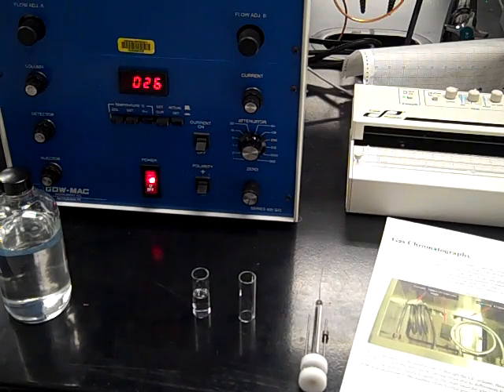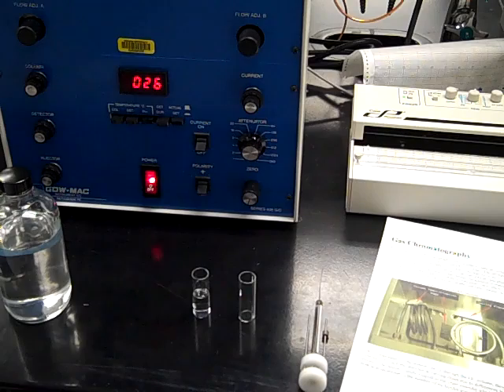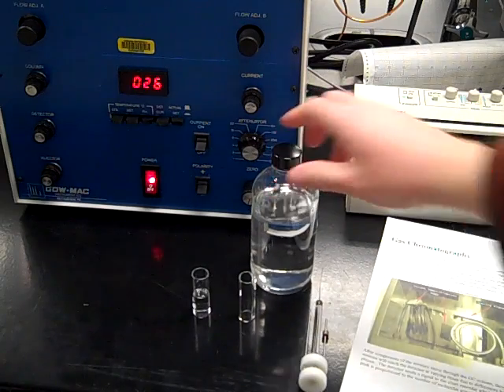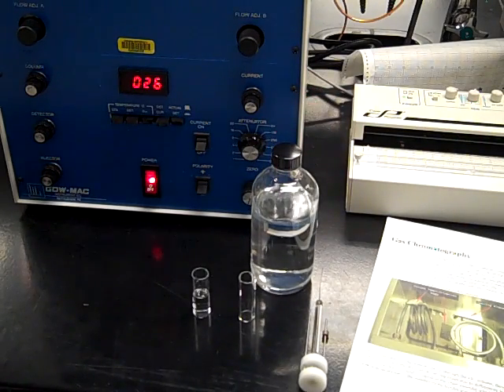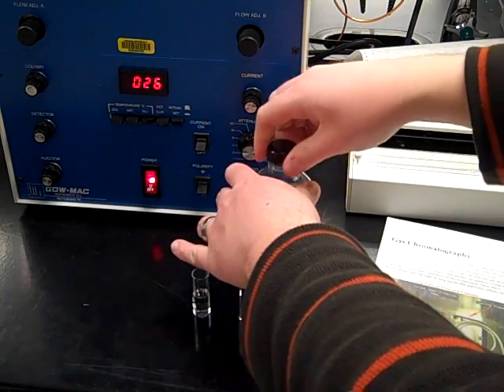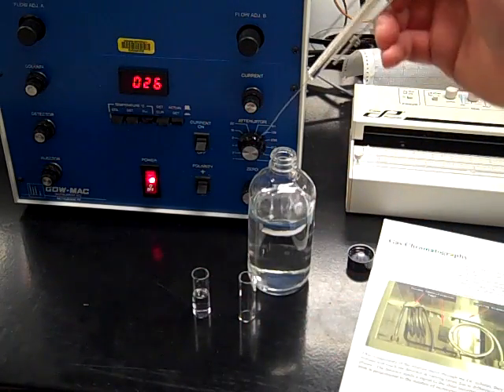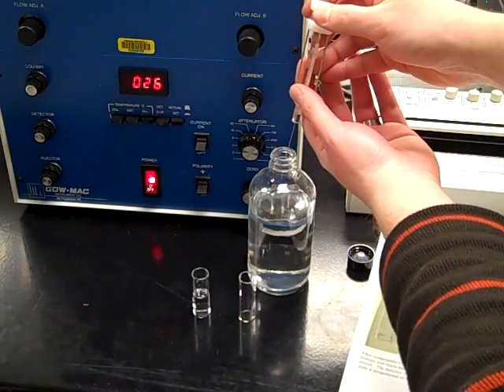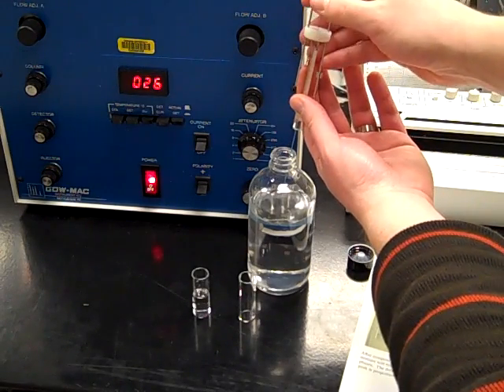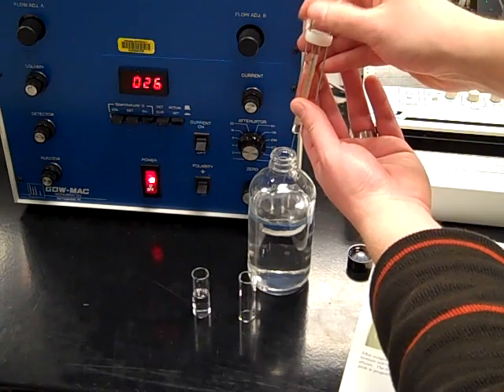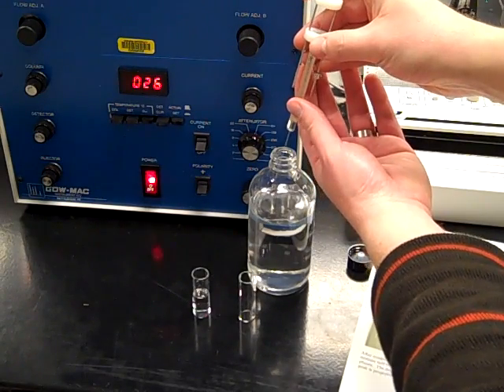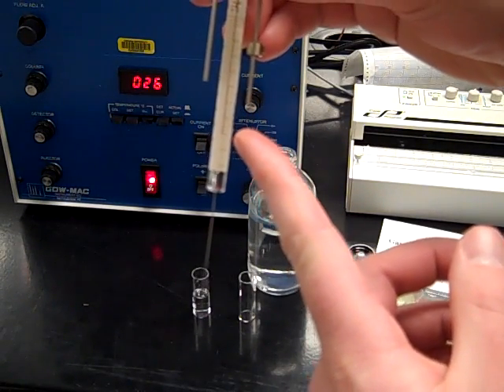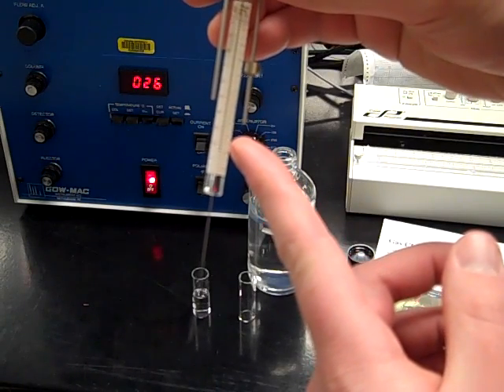And then the operations manual is this paper over here to the right. So the first thing you're going to do is take your actual sample and get ready to inject that into the GC. With your syringe, you want to put that down so the needle is inside your sample, and then pump it up and down several times like this. What that's doing is getting the air bubbles out of your syringe. Eventually, once you've got all the air bubbles out, you can pull it up and look on the markings so that you get to one microliter of that sample.